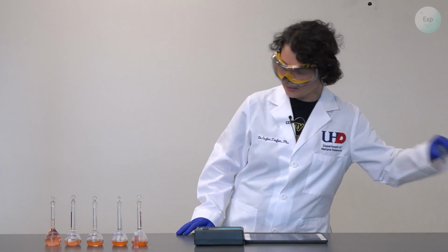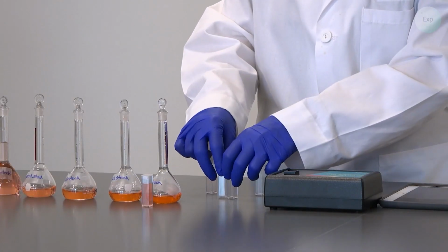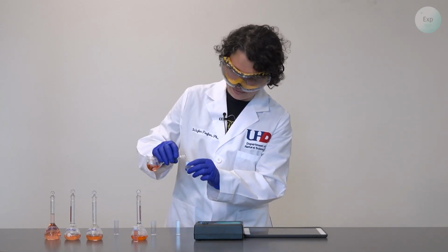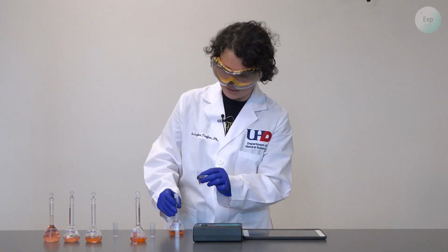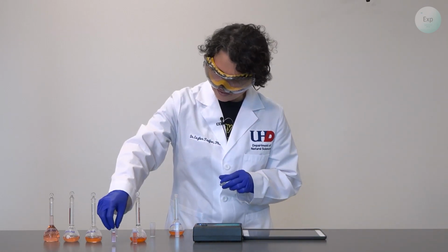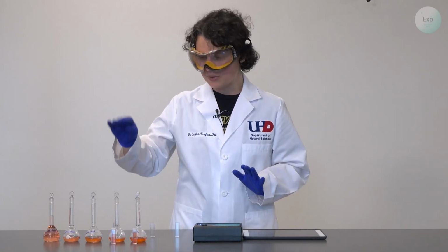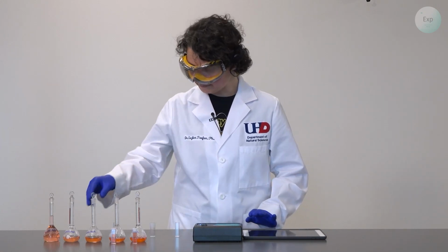Then I will need 4 different cuvettes for my 4 diluted solutions. And just like before, with these plastic cuvettes, I am only going to touch the ridged sides. I will fill each of these cuvettes approximately 3/4 of the way full with solution. Place a cap on top, and then create a careful association between my stock solution and the cuvette without labeling it, because the cuvette will need to go into the spectrophotometer and any label will interfere with that.